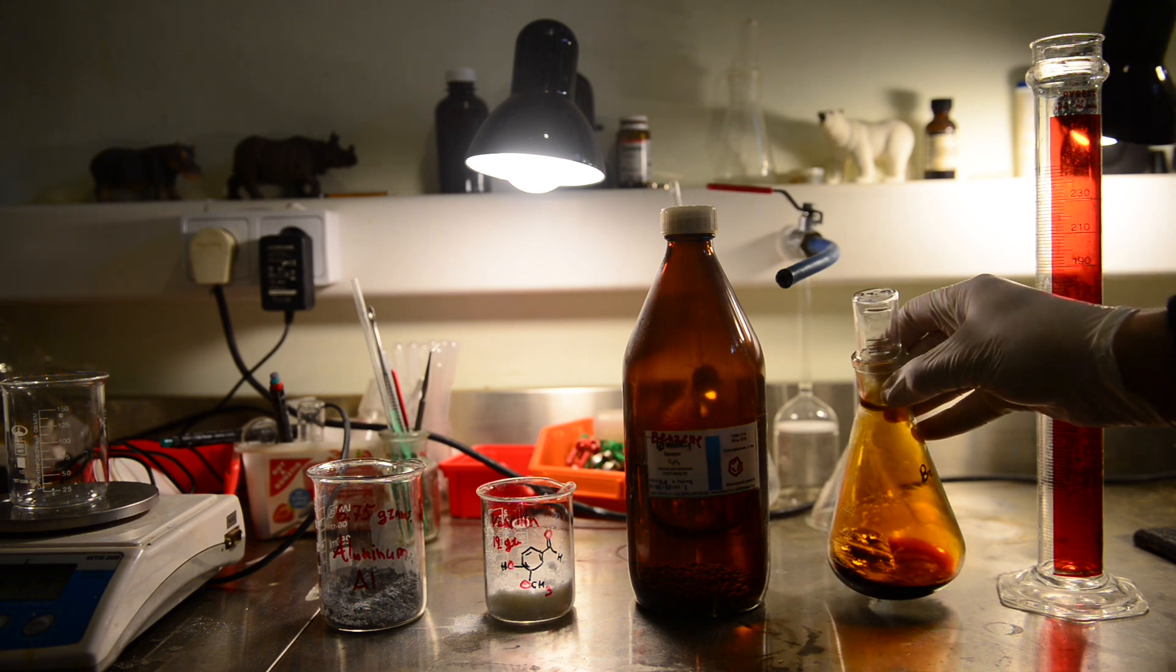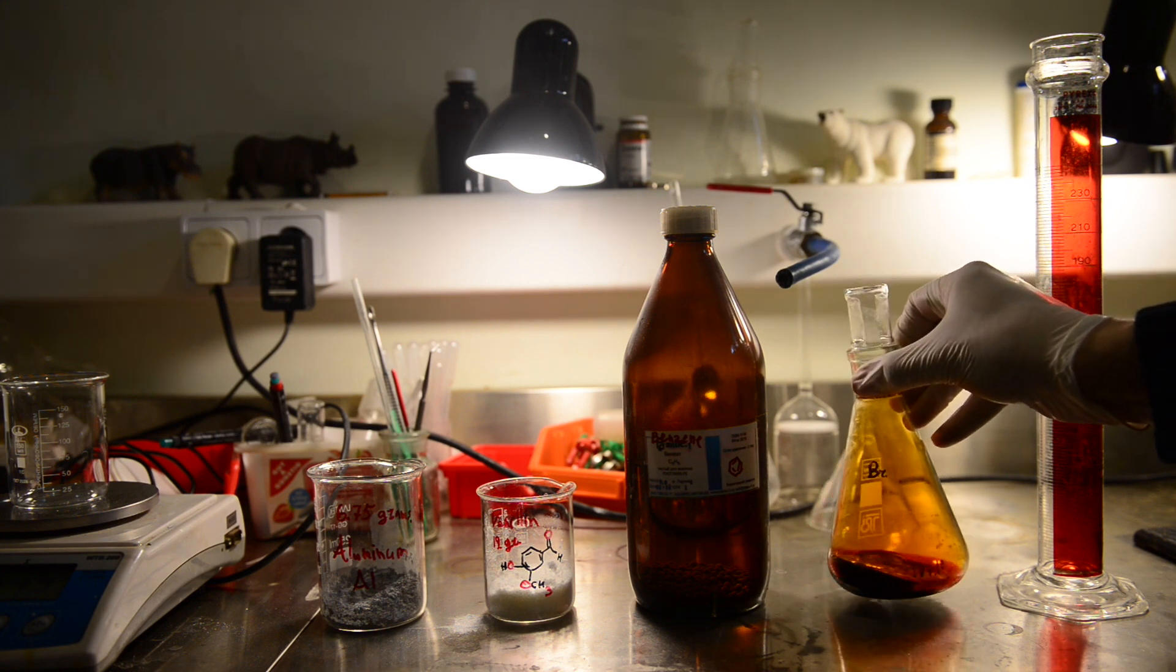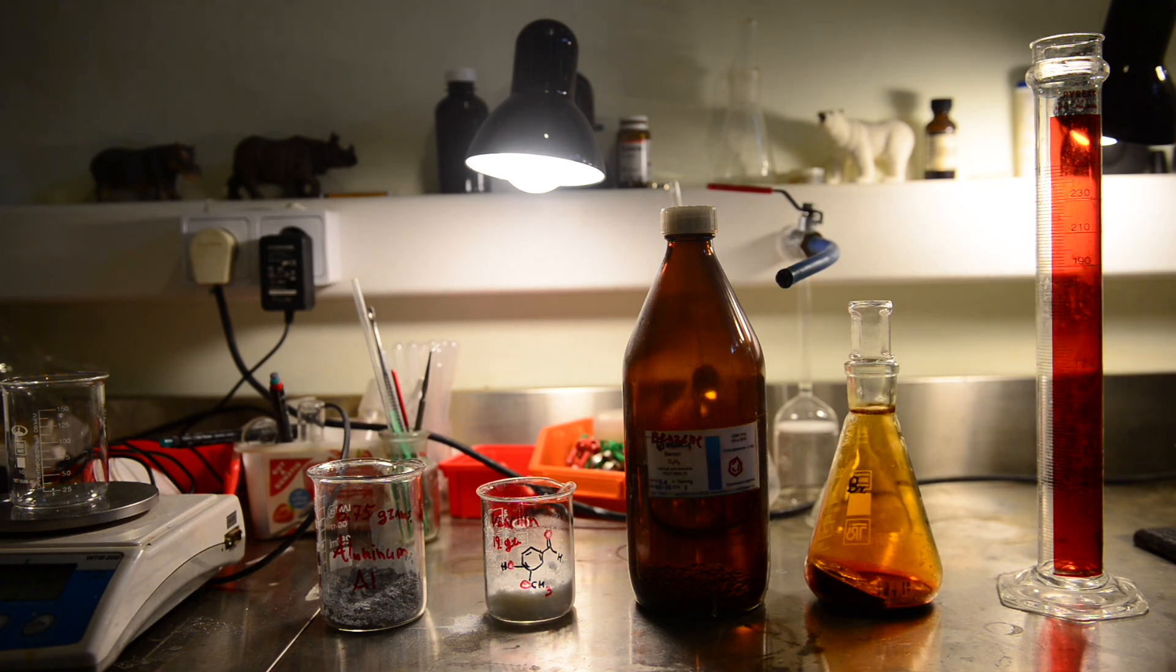I am excited to start experimenting with vanillin demethylation reaction. This time I have everything ready.